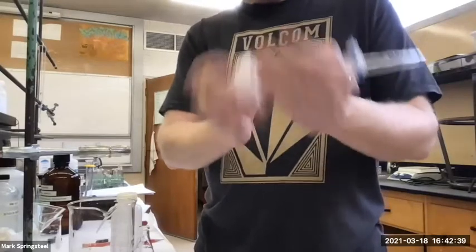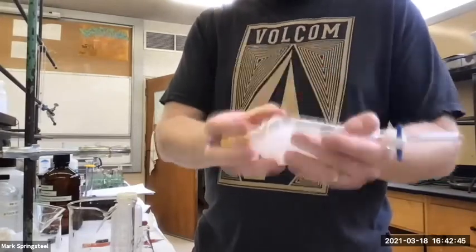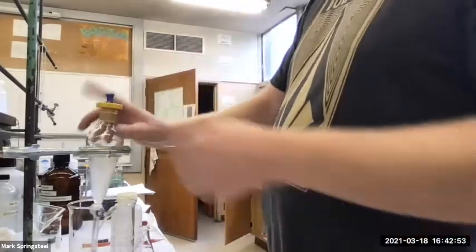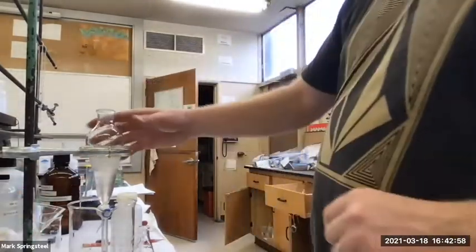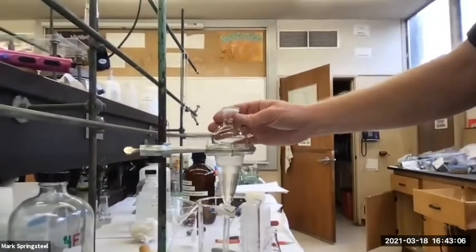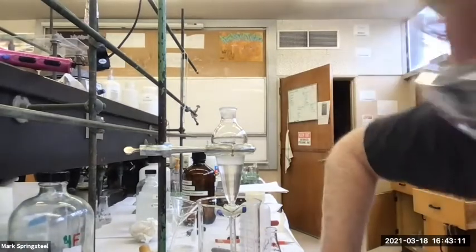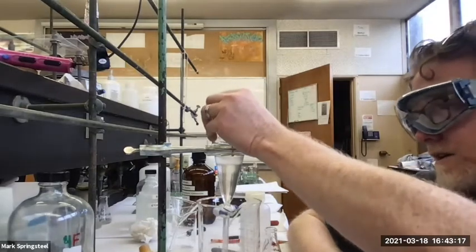So the brine is very salty, so it's drawing water into it. It wants to dilute the salt ions in the water. It's drawing water out of the organic layer, making the organic layer drier. Similar to osmosis, but instead of a semi-permeable membrane, you have two heterogeneous layers. And you'll notice, I don't know if you noticed, the brine separates out quicker than the other aqueous layers, because I think of brine as more polar than water and more polar than the HCl and NaOH, so it separates out really well.